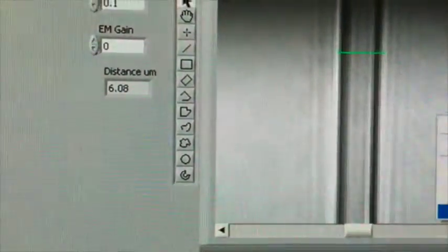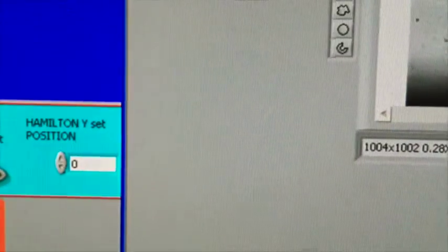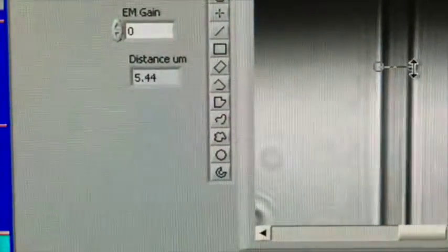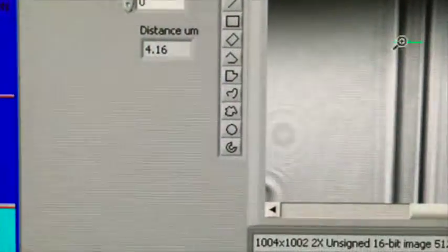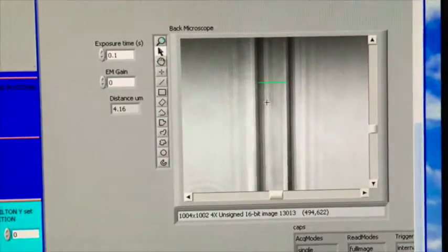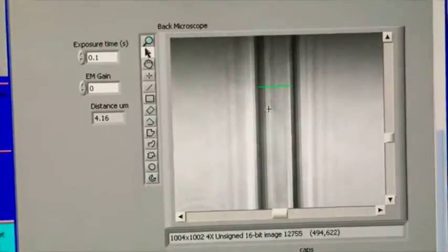I'm now going to zoom to fit, which is going to pull me back out. That's about 4 microns. No, that's 6 microns, sorry. I actually want to make 4 micron tips, so I'm going to go in here. I'm actually going to do it this way. I'm going to pull this until it's about 4. Actually it goes to 4.16. And again, this is a little bit too big still. I'm trying to cut it at 4, so I'm going to pull it up a little bit.